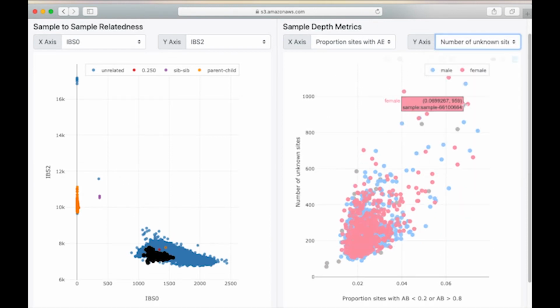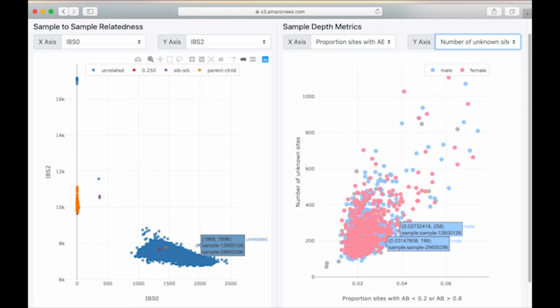If we hover over a point, it gives metadata about the sample and highlights a number of points in the left-hand plot. In that left plot, each point is a pair of samples that are again colored by information given in the manifest. Here, the color gives the relationship between samples. The current axes compare identity by state values. IBS 0 on the X is the count of sites between a pair of samples where one sample was homozygous reference and the other was a homozygous alternate. This should not happen between a parent and child except in the case of a deletion.